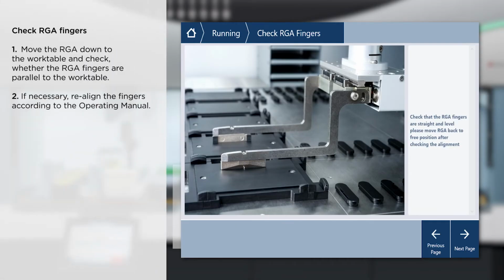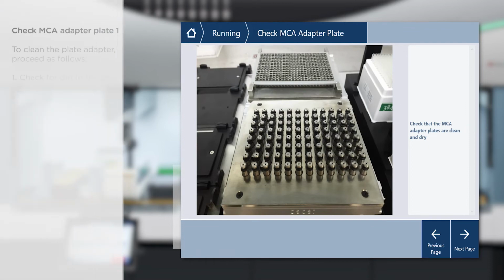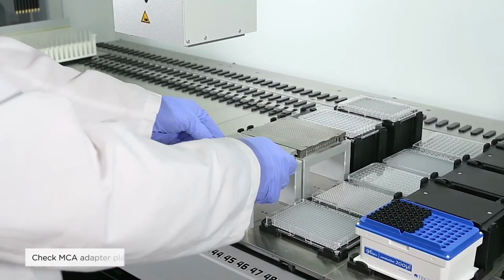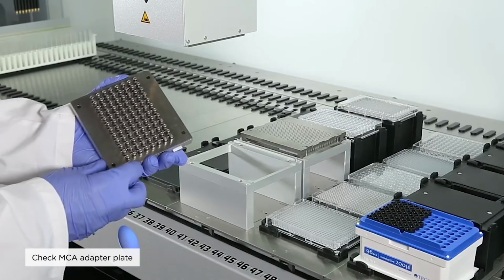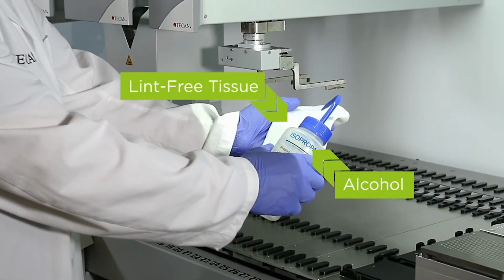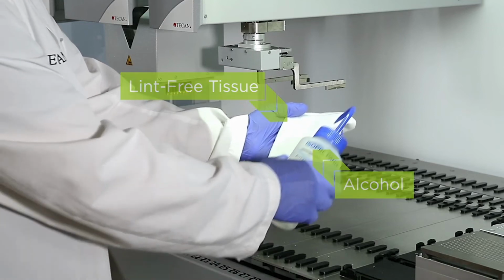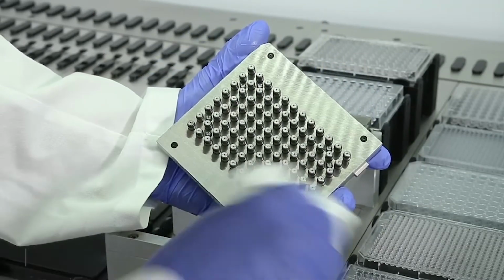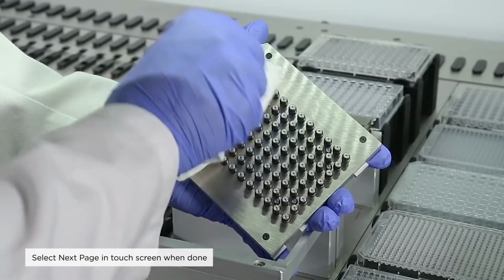Now you need to check the alignment of the robotic gripper arm fingers. Pull the robotic gripper arm head down and realign it if necessary. Check how to do this in your manual. To remove any particles, grease, or dirt, soak a lint-free tissue with alcohol and wipe the surfaces and individual cones of the multiple channel arm adapter and select Next Page when done.